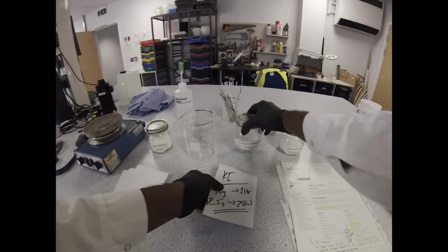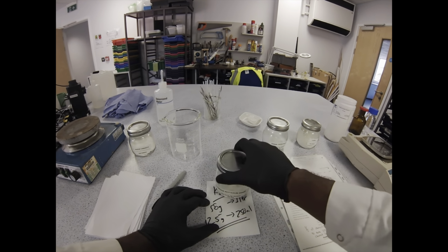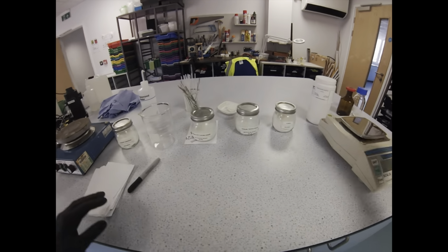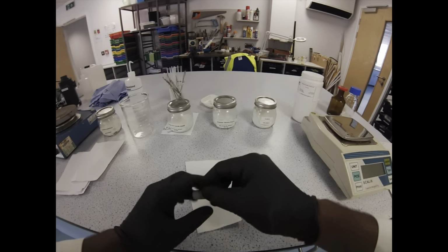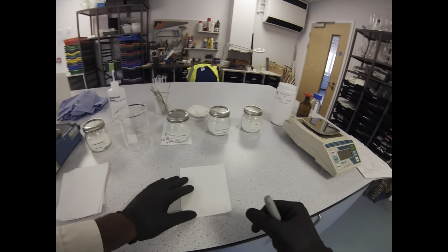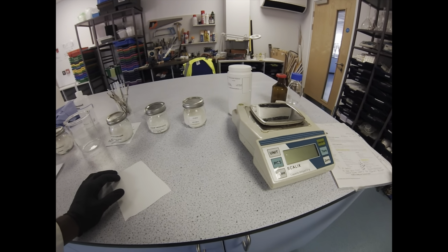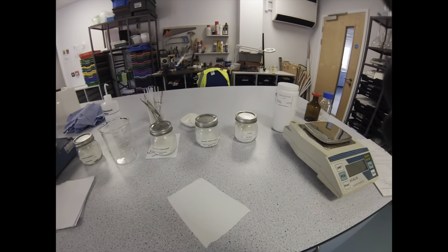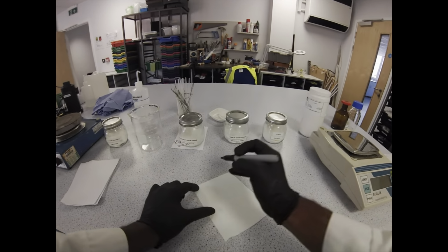I always have these little square scraps of paper lying around in my lab, and they're really good for making lots of solutions. We're going to be making two mixtures today, two solutions. One of them is going to be lots of solids dissolved into a solution, and the other one will be liquids. I will go into the science of what's happening in terms of the chemistry, but right now we're just going to do the bare bones of putting it together.